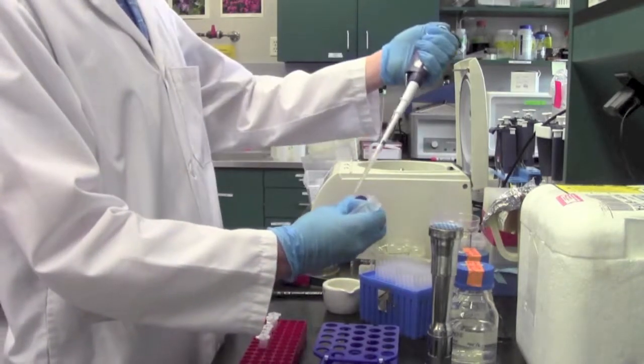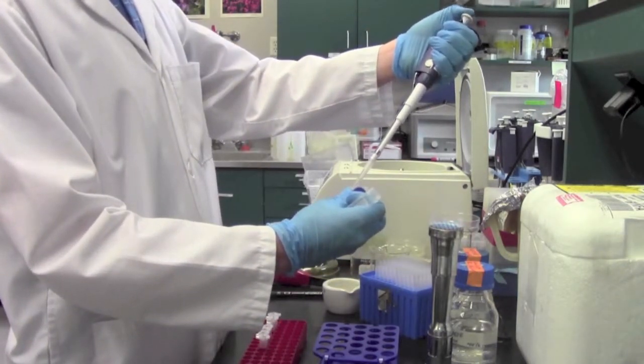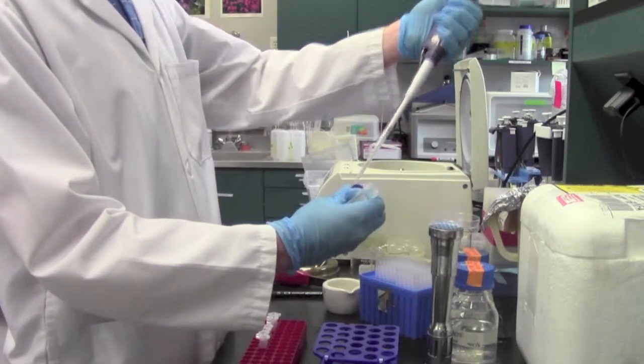So now I'm placing the supernatant from the centrifuge into one central tube.